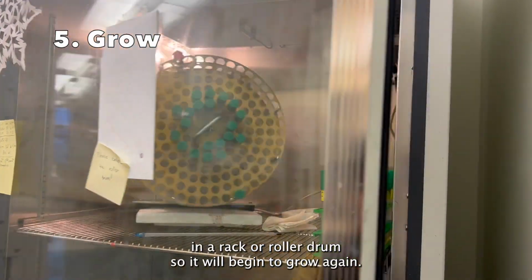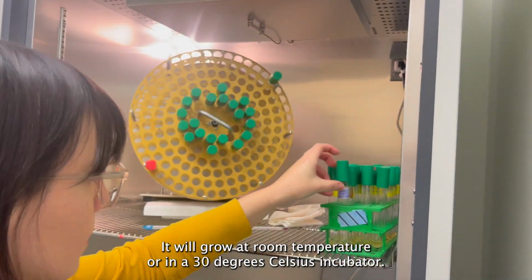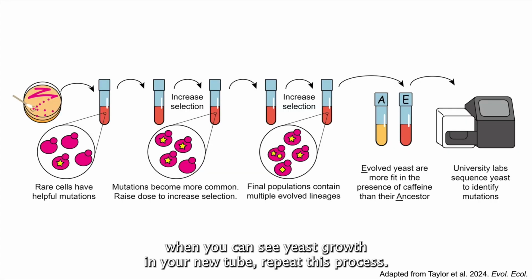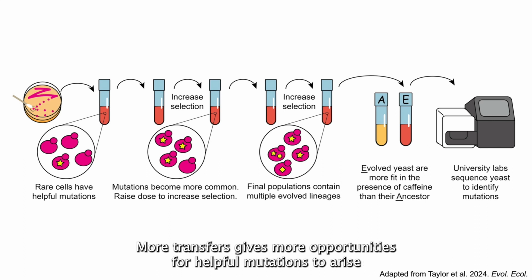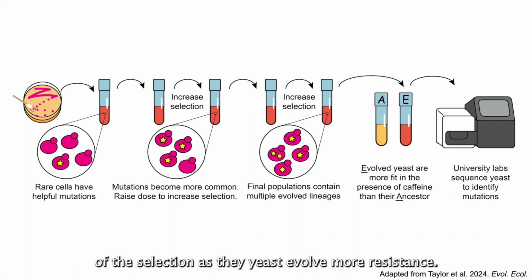Place your yeast in a rack or roller drum so it will begin to grow again. It will grow at room temperature or in a 30°C incubator. After a few days, when you can see yeast growth in your new tube, repeat this process. More transfers gives more opportunities for helpful mutations to arise as the yeast grow, and will allow us to transfer into higher concentrations of the selection as the yeast evolve more resistance.